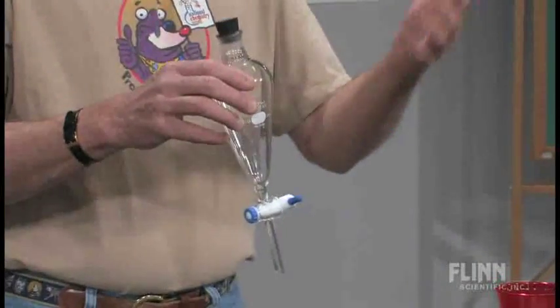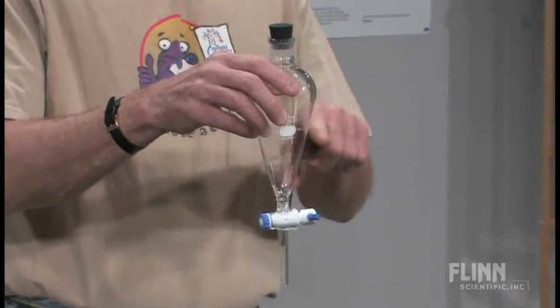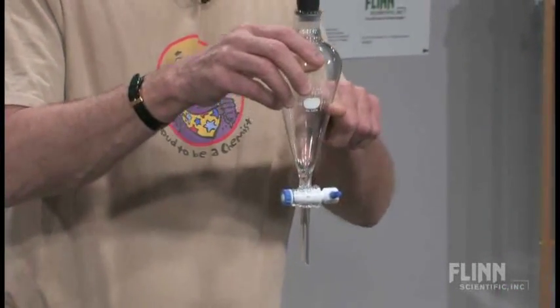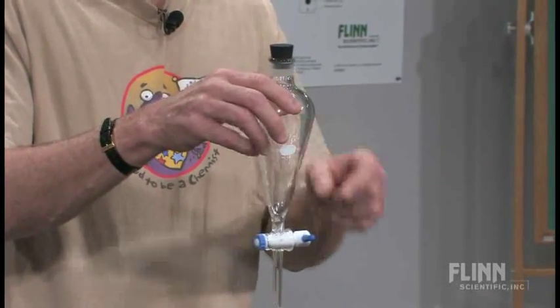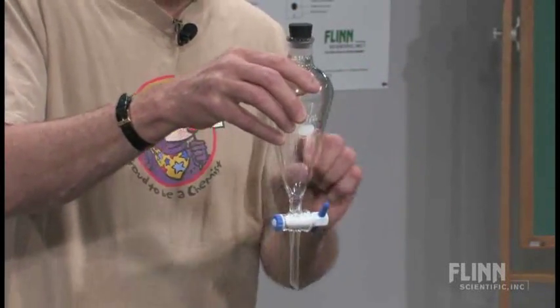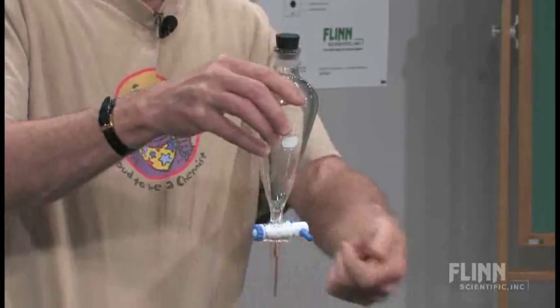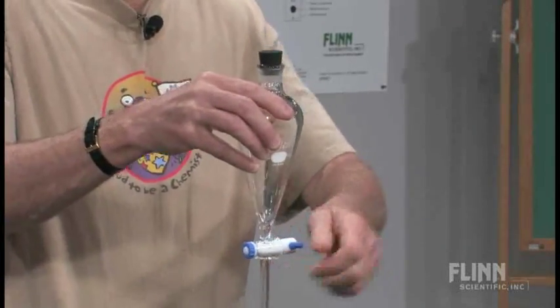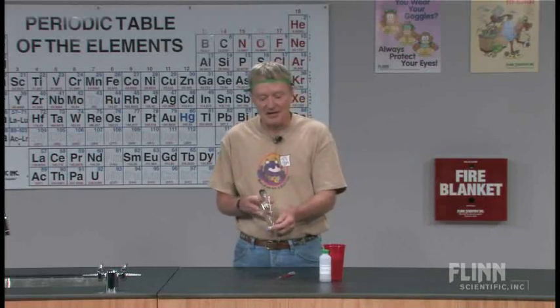You get a mixture of, say, oil and water, you pour it inside here, and the lighter material would be on top, heavier material would be on the bottom. You could see the interface layer between the two. You'd open the stopcock, drain the liquid out to right before it got to where the interface layer was, close it, let out the interface layer, and then go back and separate it. Really kind of a neat laboratory wet technique.